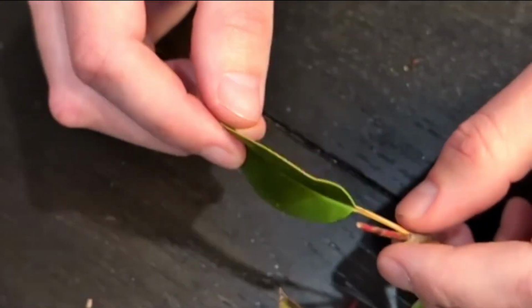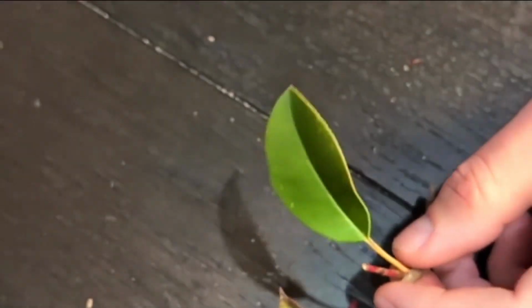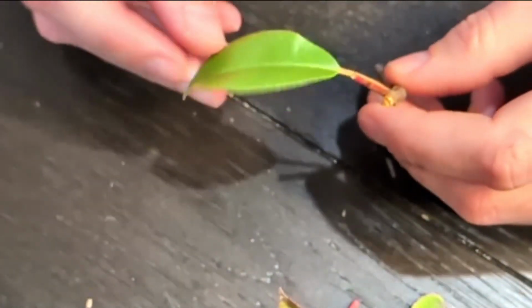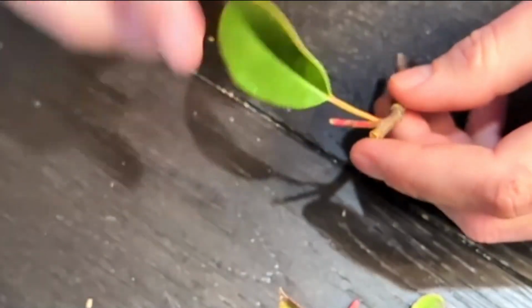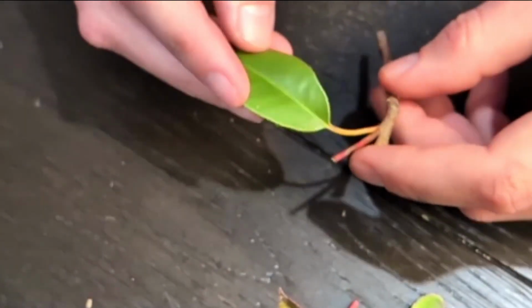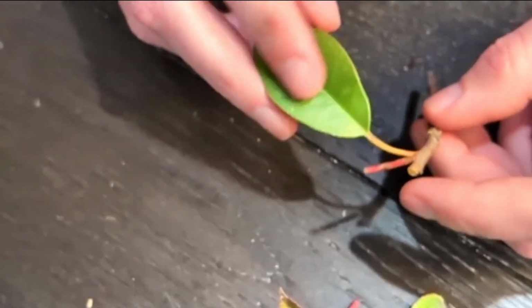And we're going to start to go into other leaf modifications here. So we're going to first start talking about compound versus simple leaf. First, this is just a simple leaf. A simple leaf meaning there's a stereotypical leaf, one individual leaf, just like this, right? That's a simple leaf. We're going to start off with palmate leaf.